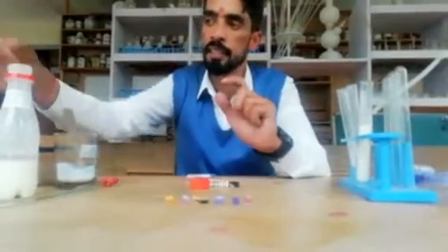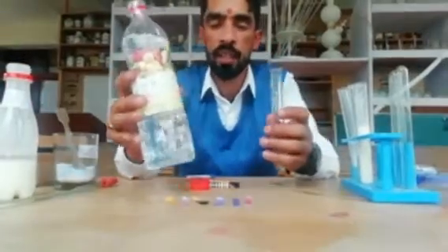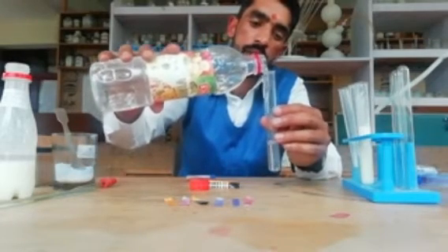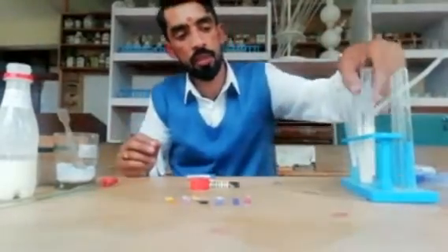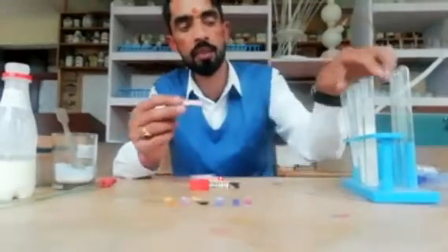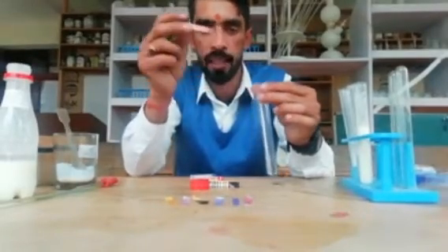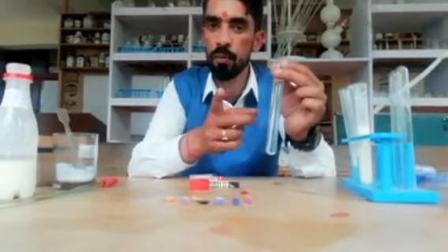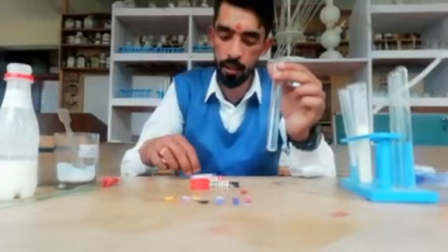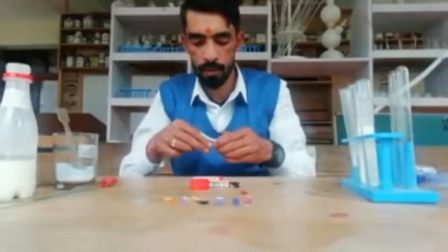Now we will use the third sample — vinegar. We use vinegar when having thukpa and other dishes. Let's do the practice demonstration with vinegar. First I am taking red litmus again. It will not change — it will remain red to red, because vinegar is also an acid. The acid present in vinegar is acetic acid, also known as ethanoic acid.